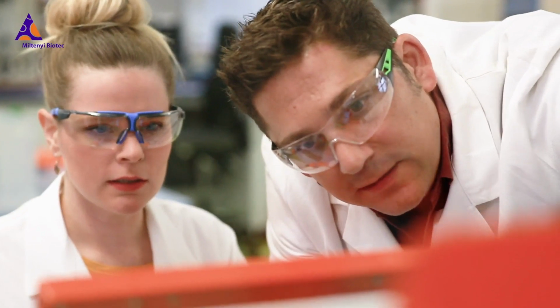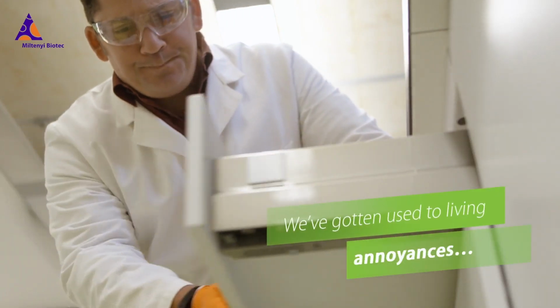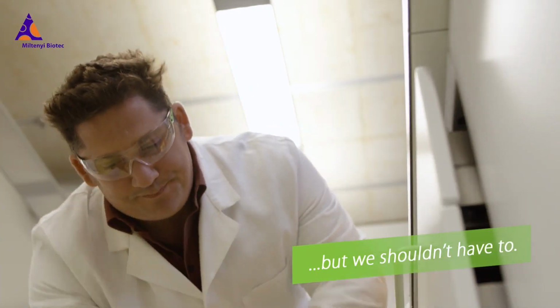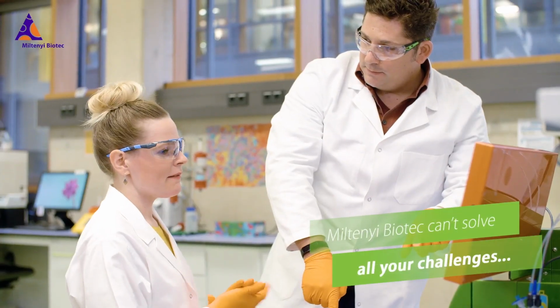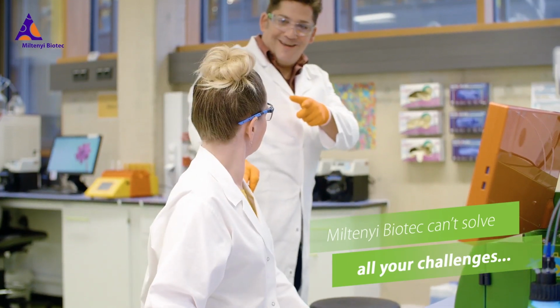Let's see. Advanced settings. Just one more second. Anyway, do you think you got that, or shall I run through it again for you? No, I'm good. Okay. Let me know if you need any more help, okay?